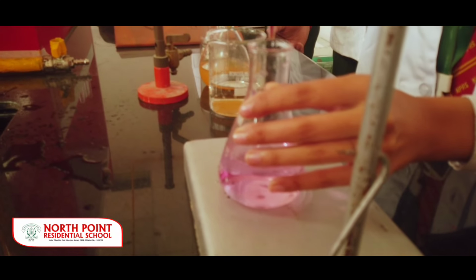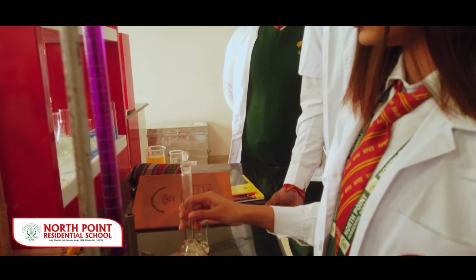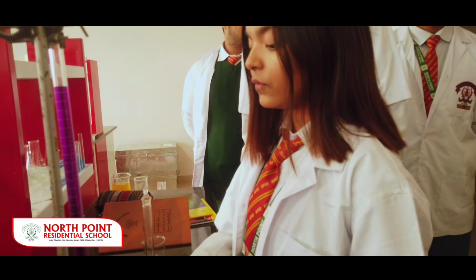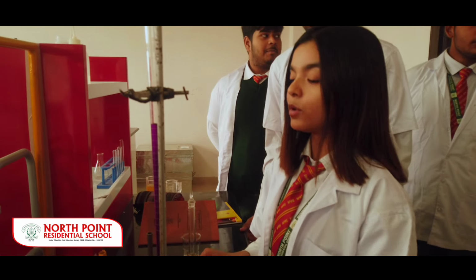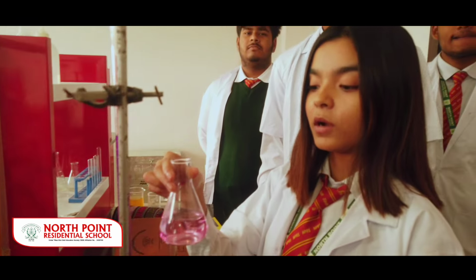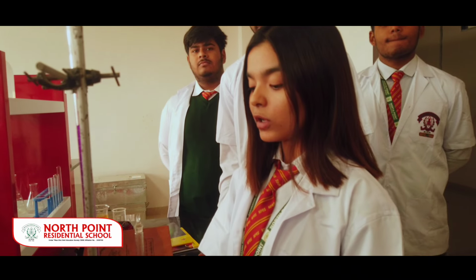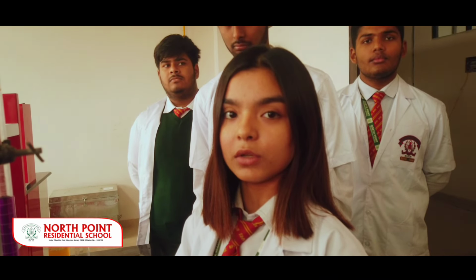Here we have the burette, this long thing, and in this we have used two chemicals, that is oxalic acid, and the second one is diluted H2SO4 solution. And in this we have the mixture of both the things. And in this the purple color solution is KMnO4 solution. And we can see that there has been a color change in the solution. We can see a faint pink color in the solution, which means that it has been successfully titrated. So talking about titration, it helps in determining the strength and the molarity of the solution.